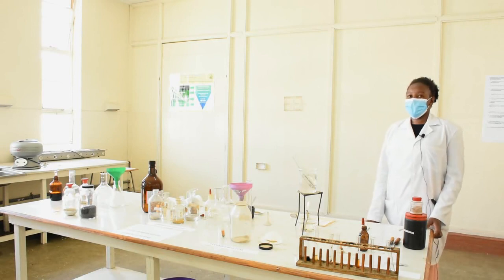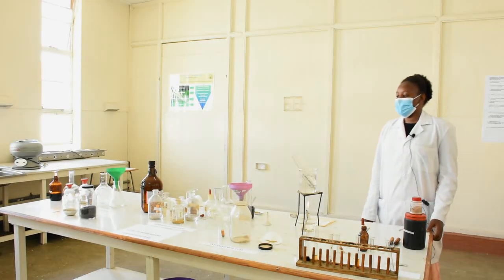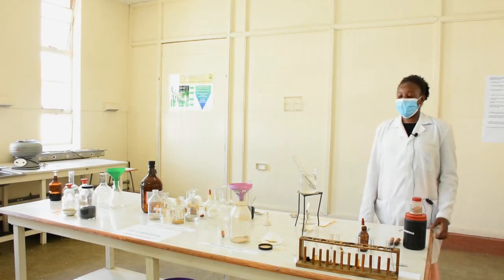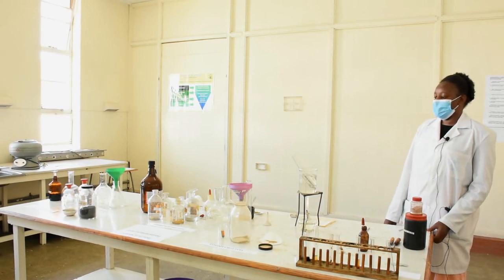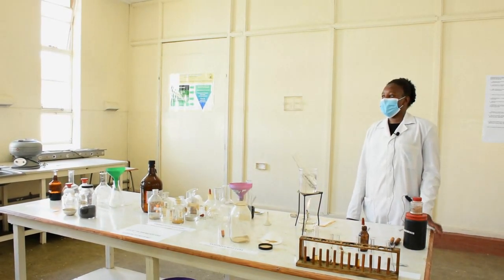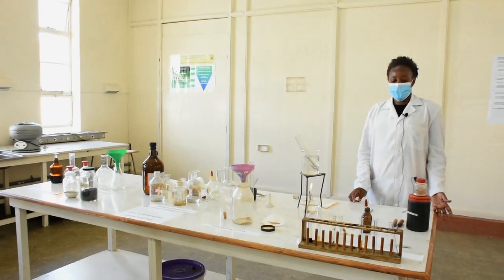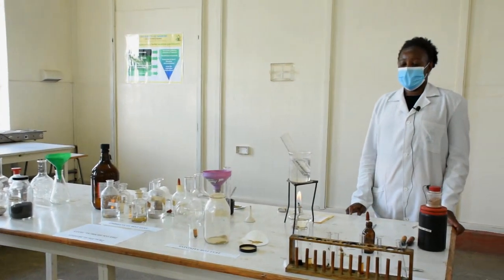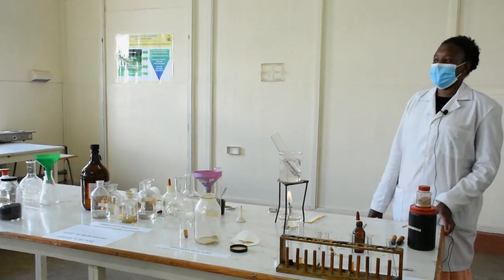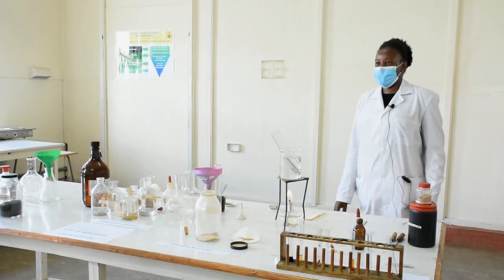The third practical we are going to conduct is the test for phytochemical constituents in the plant. The common ones are tannins, saponins, glycosides, and alkaloids. For tannins, we had two varieties — hydrolyzable and non-hydrolyzable tannins — and we know that when reacted they give different color reactions depending on which type they are.